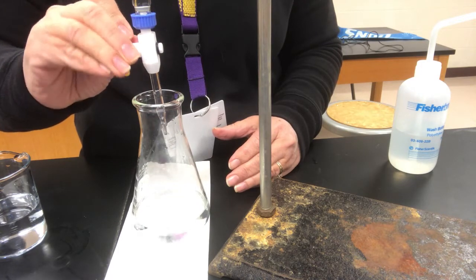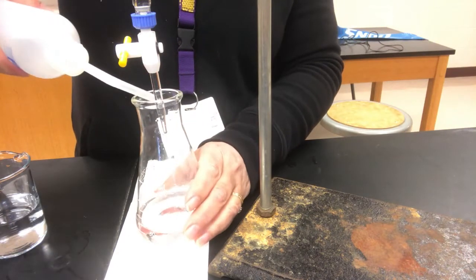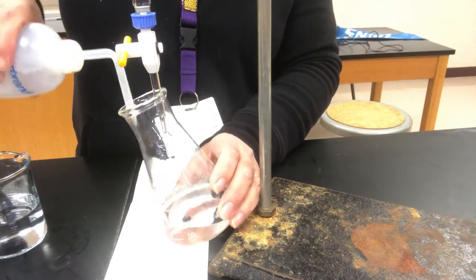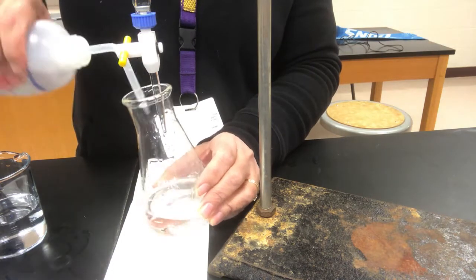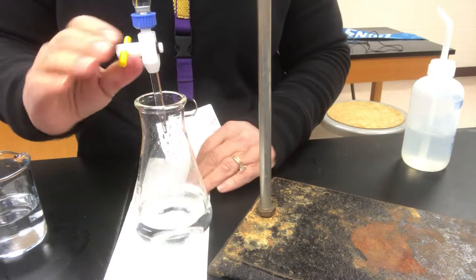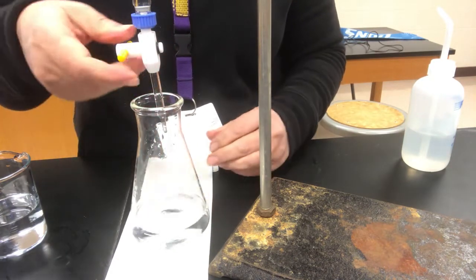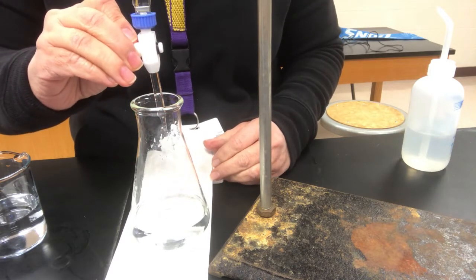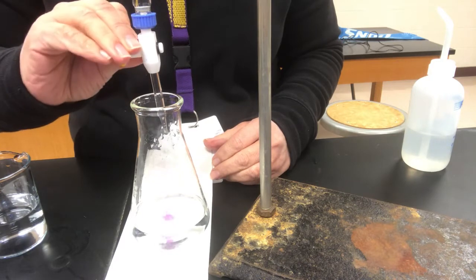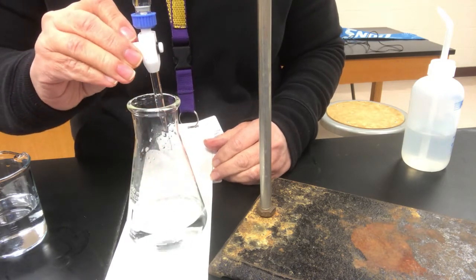And I think I'll take this opportunity to make sure that all my reactants are where they're supposed to be, and just rinse everything down the sides. Everything needs to be at the bottom of the Erlenmeyer. Of course, there's always some water droplets clinging, but all the reactants should be forced to the bottom. Whoops, I meant to do a drop and I just squirted. But luckily no harm was done, as the red did not linger. So let's do another drop. And another drop.